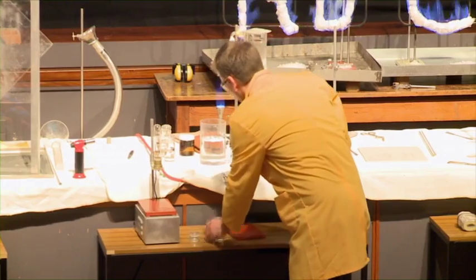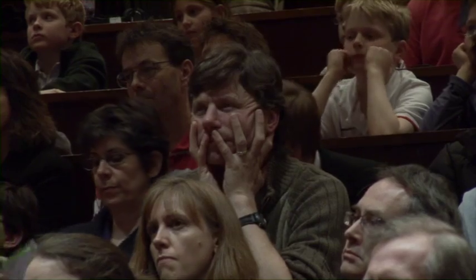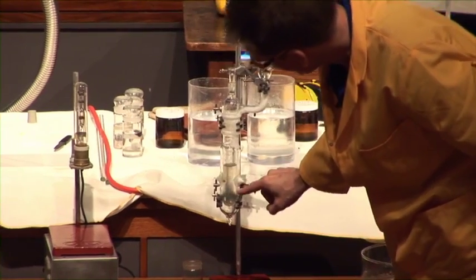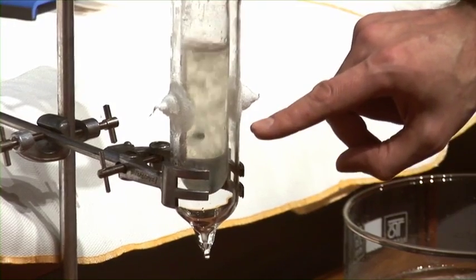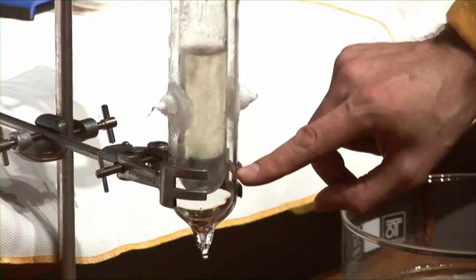So I have some sodium here, I'm going to add this into the ammonia. And you should be able to see on the camera here where the sodium is reacting in the ammonia, and we're getting a blue colour.